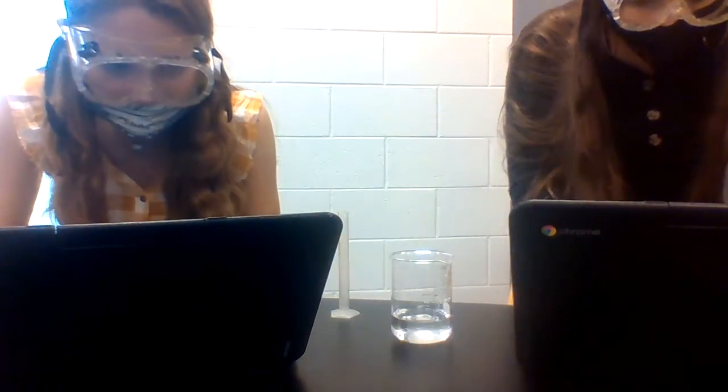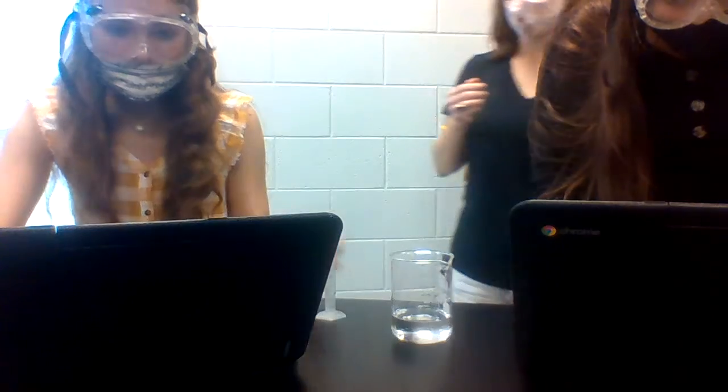Normally we would do that. Oh, I did mine really bad too. That is so bad. I just poured like 2 whole milliliters in there. Okay. 4.8. Teacher, check the record value for the volume.